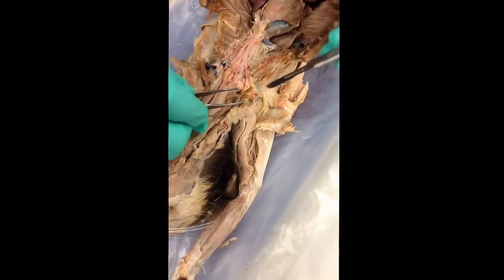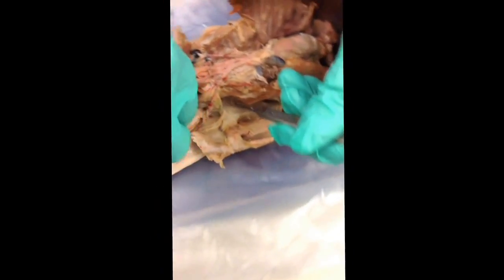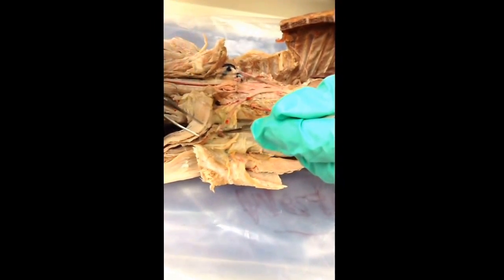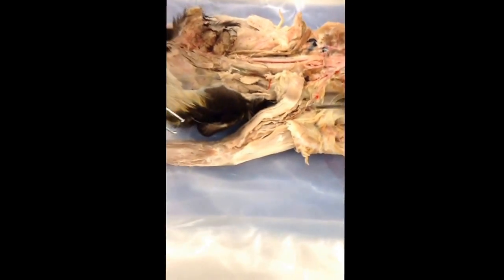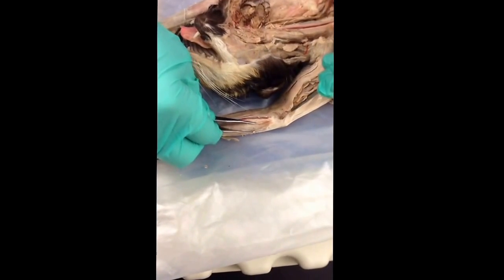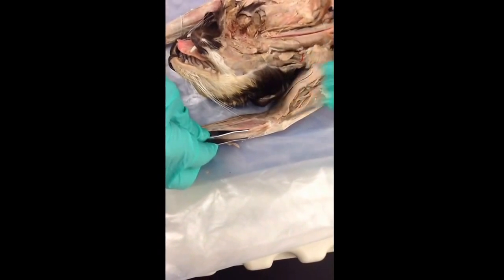Now, the axillary, after the thyrocervical comes off, it's the axillary on out, and it's like a highway changing names. The significant one going down is the subscapular. Then coming on out toward the arm is the brachial. It's brachial all the way down until it goes through a hole in the bone called the supracondylar foramen. Then the artery becomes known down in here as the radial. I don't ask anything down here but the radial.